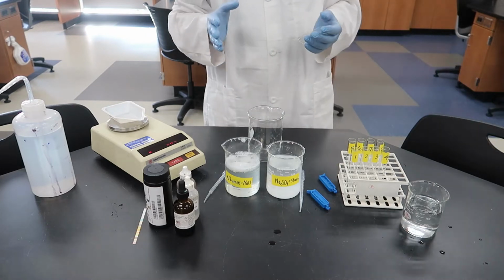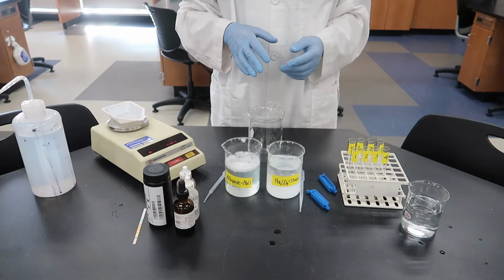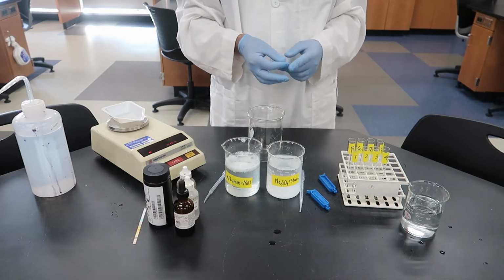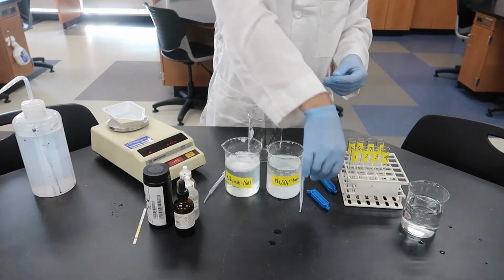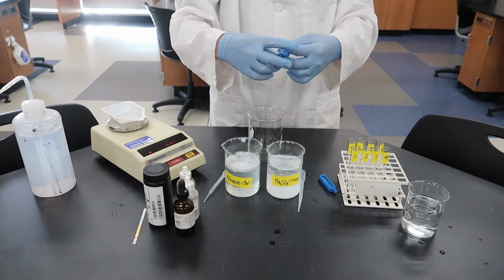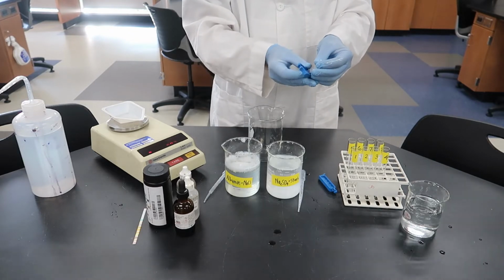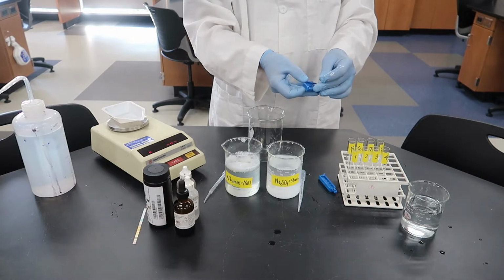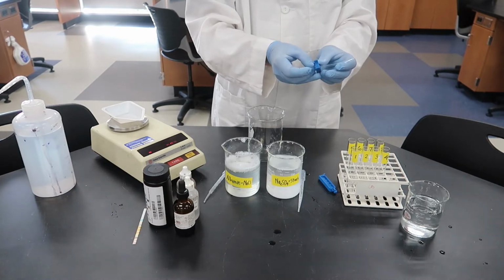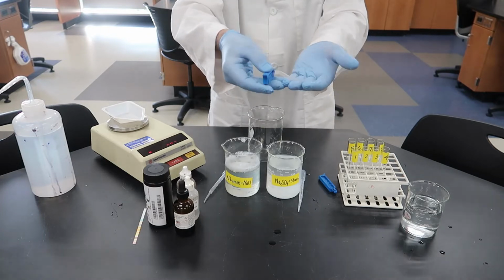And so I'm going to go ahead and put inside the bag the solution that we're going to test there. And if you remember my design, we were going to put the albumin NaCl mixture in the bag and the sodium sulfate and starch mixture in the beaker. You could do it the other way around, it doesn't really matter, and you could do this experiment lots of different ways, but that's how we're going to do this one just to see what happens.